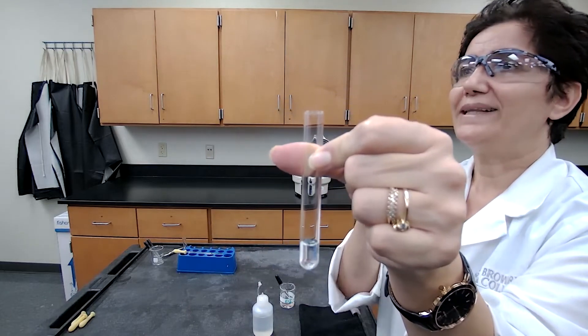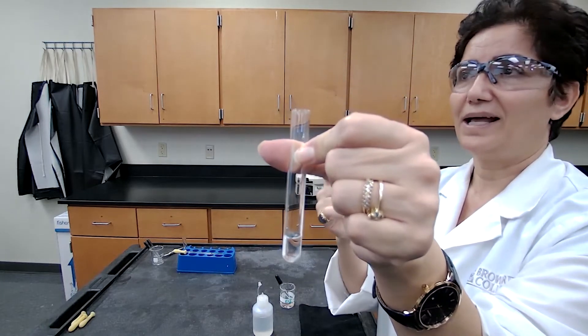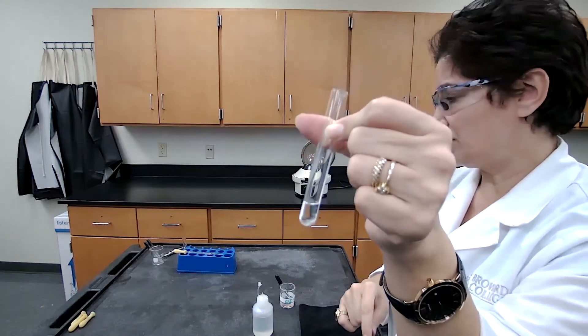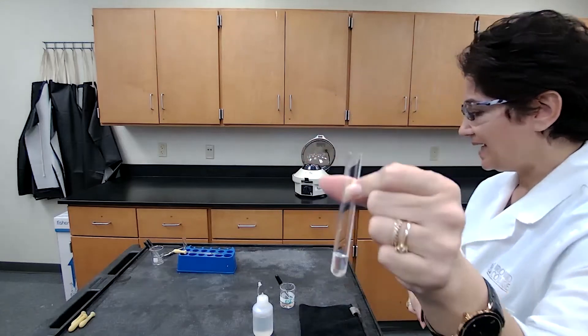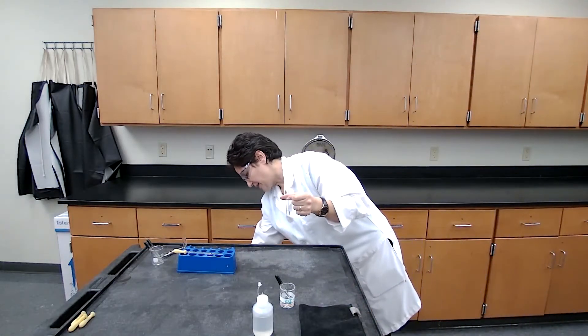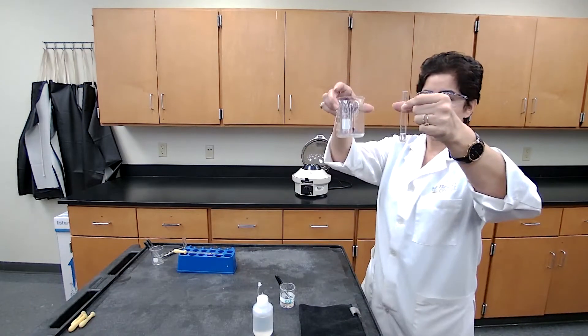At this point, I do not need the centrifuge again, and I'm going to separate the clear solution by decanting into another test tube or a base container. I'm going to use this as my base container.